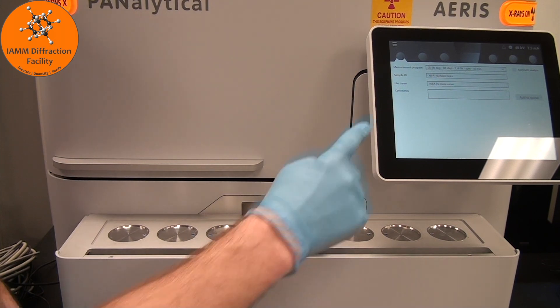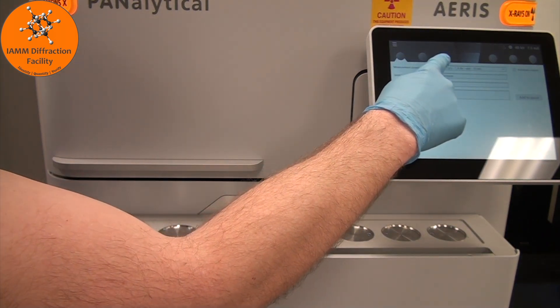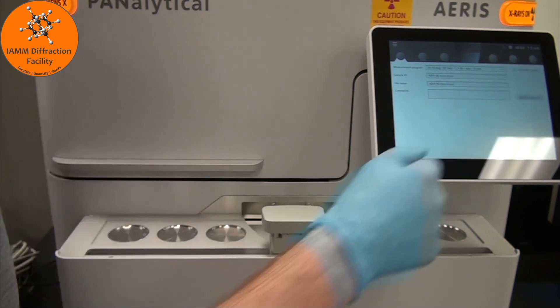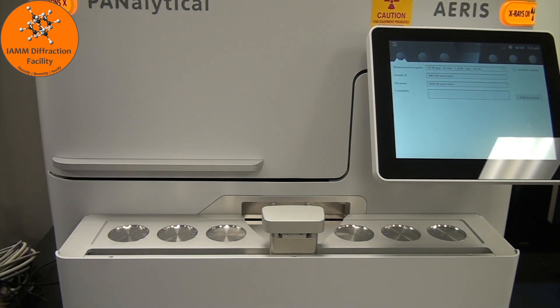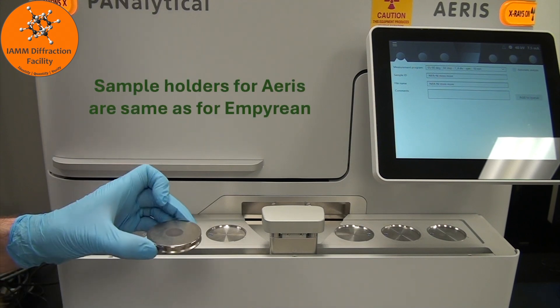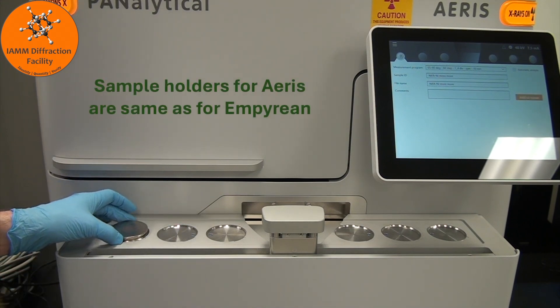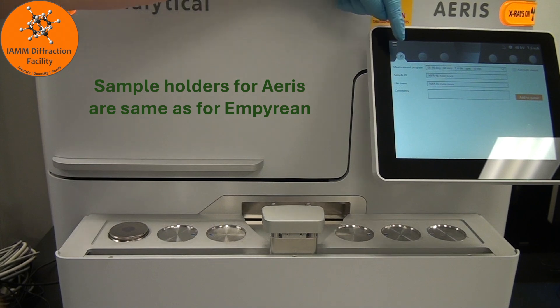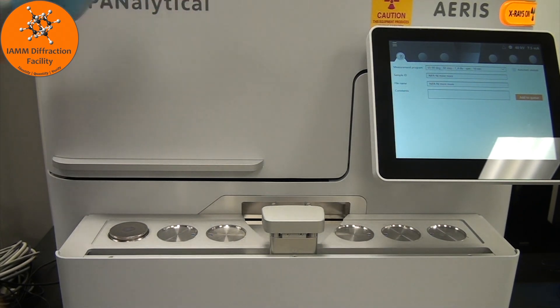These correspond to three circles up top on the left and three circles up top on the right, so each circle corresponds to a sample position. I'm going to take my sample and put it in this first position. At that point, we see a question mark appear on the screen in the first position circle.